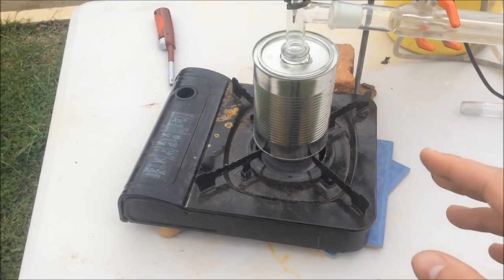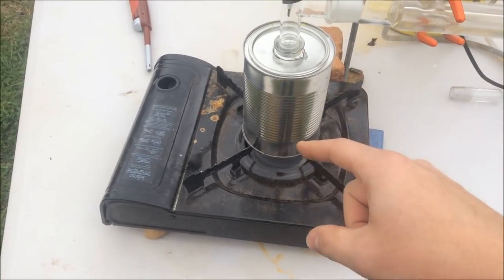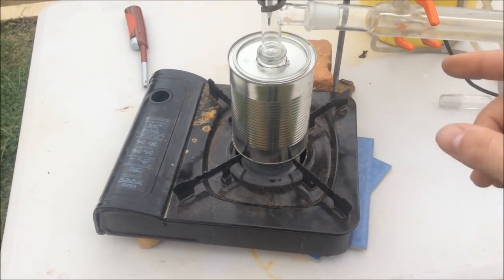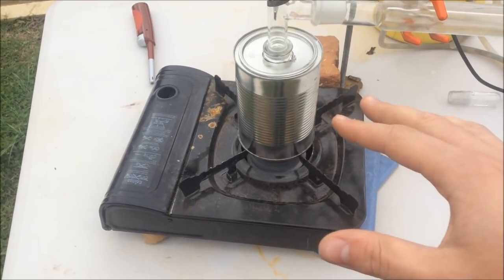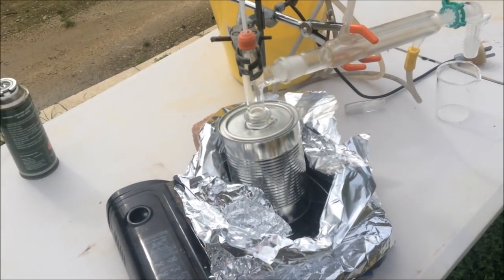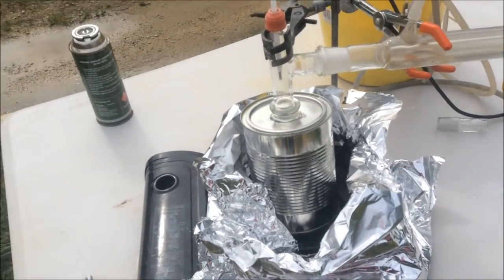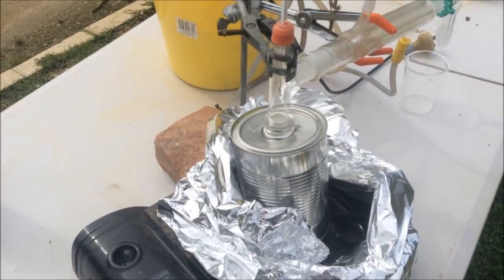But with this aggressive way of heating, it'll be even harder to get that separation going, especially seeing as we'll probably heat this metal can up to, you know, 300 degrees as we're boiling off the ethylene glycol. And then as soon as it finishes distilling off, the sodium hydroxide will melt from the residual heat. So it's a bit of an issue, but we'll see how it goes. So it's sort of started to distill over now, but to say it was playing nicely would be a dramatic understatement. So yeah, bumping pretty badly.